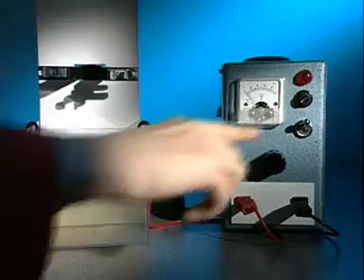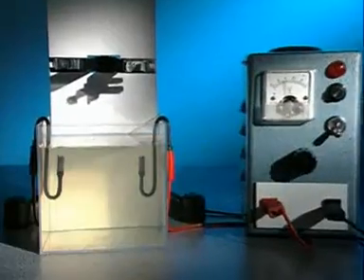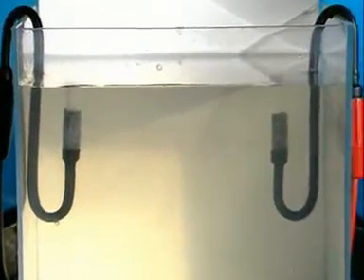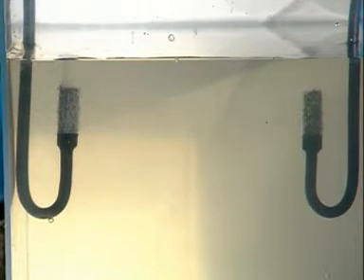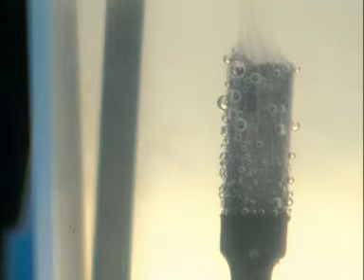See what happens when an electric current is passed through the solution. What evidence is there that chemical reactions are taking place? Bubbles appear around both electrodes, a sign that gases are being produced.